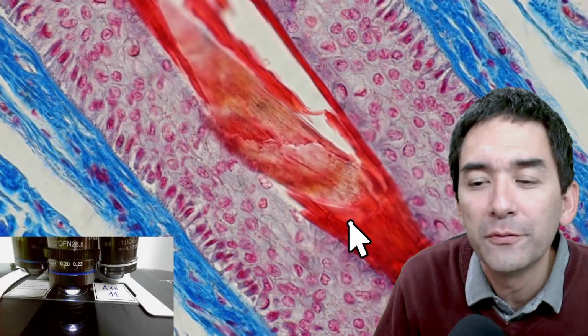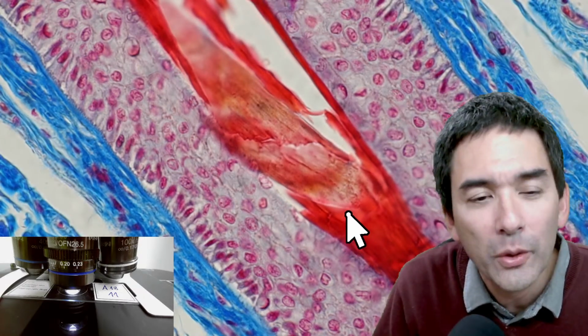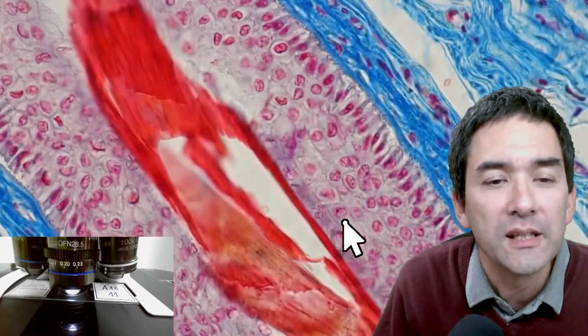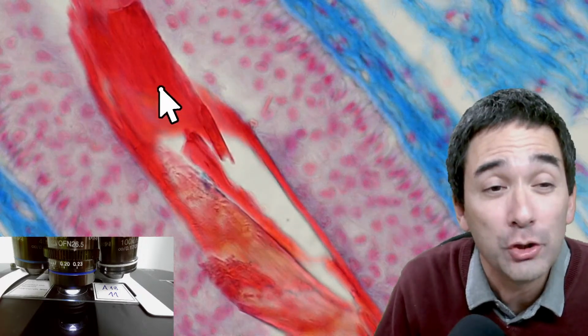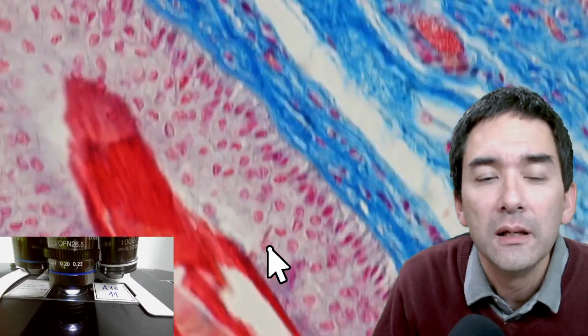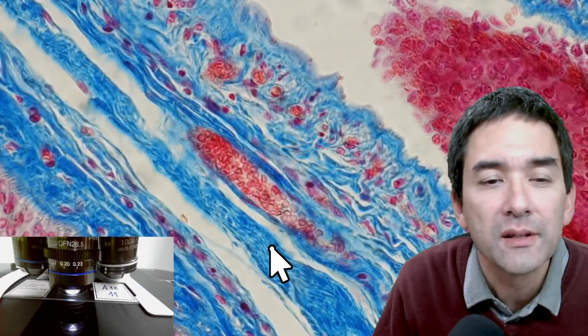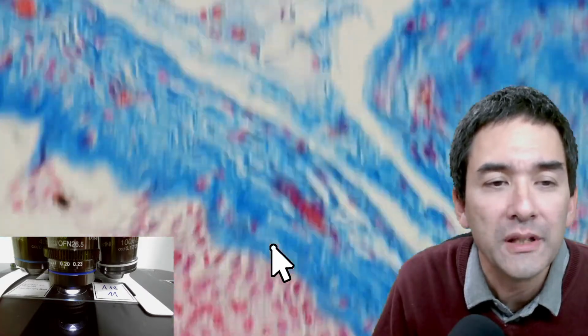It seems that a couple of different stains are used. Yes, most certainly. I don't know which ones. It's a pity. But I'm quite sure that this is stained, maybe even bleached, so that the original hair color is gone. Yeah, could be, and then it's stained. And different types of stains react with different substances. Yeah, maybe parts that are more fatty or parts that contain more proteins.